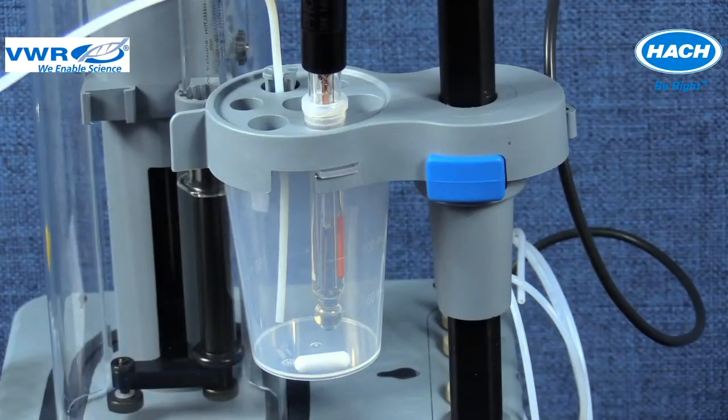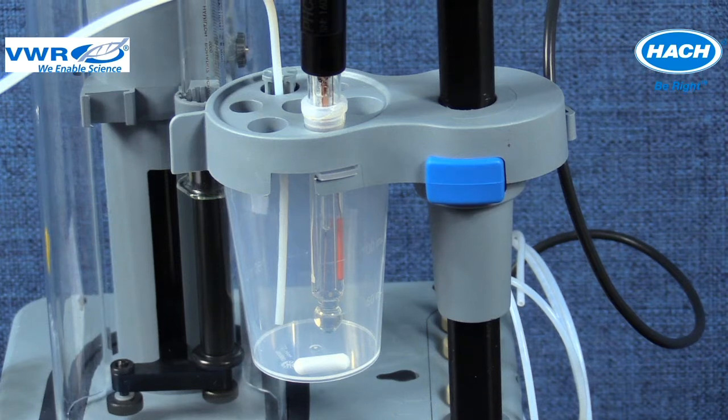The orientation of the tubing and electrode in the sensor holder is important to note. The tubing and electrode are orientated across from each other in the sensor holder. The dispensing tip from the syringe and the electrode are set to the same depth, about 5 to 10 millimeters above the stir bar in the sample beaker. Using an empty beaker will assist in setting the correct tubing and electrode orientation and depth.